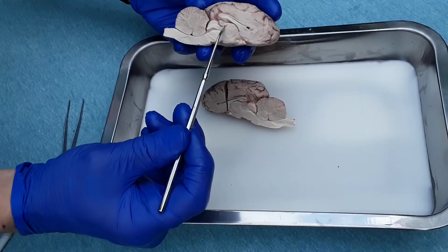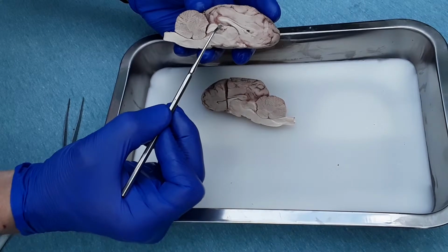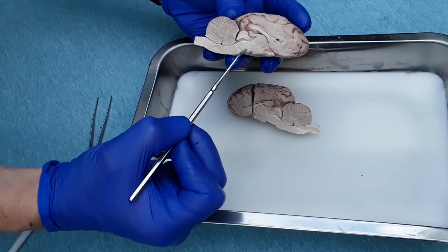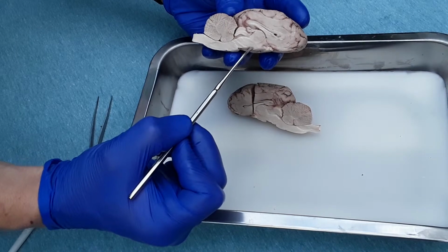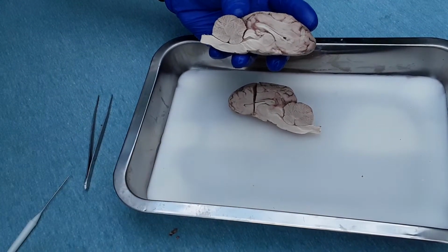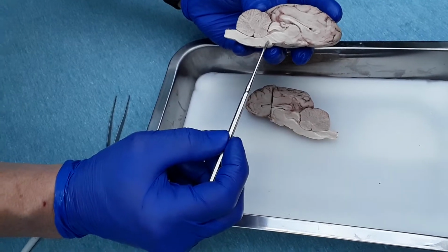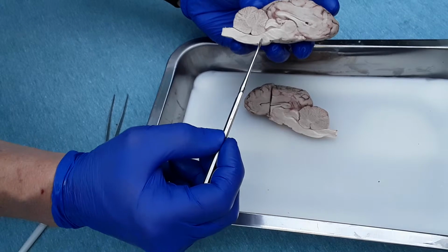This area is the thalamus, kind of well seen. This is the pineal body, this little small structure here. The hypothalamus is this raised area above the spinal cord. The pons is a small structure you can see well right here where my probe is at the bottom. The pons is a small area of the spinal cord or midbrain. I see a small bump here that represents the pons.